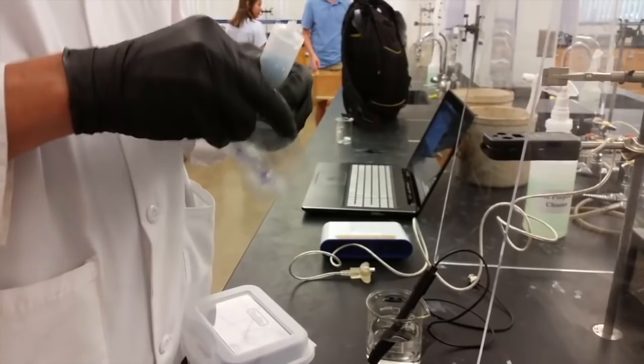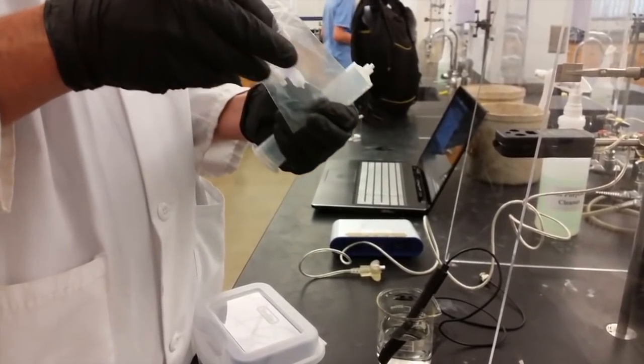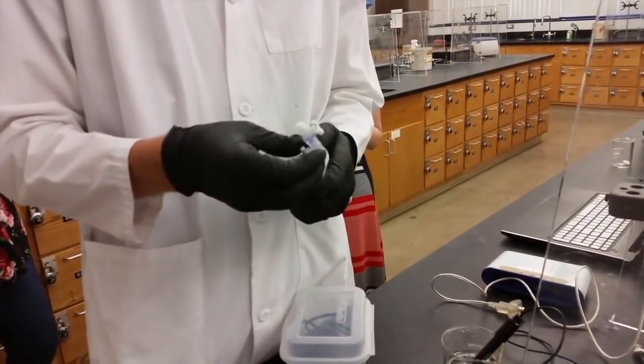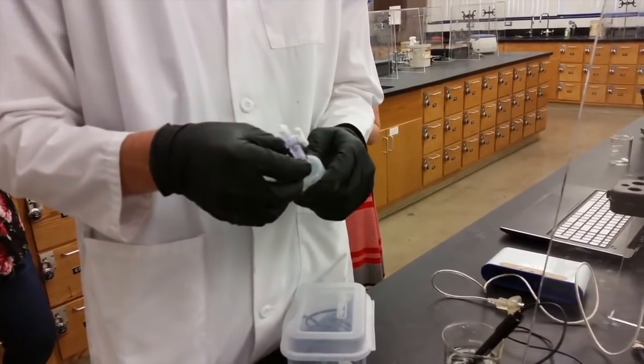The stop cocks are very delicate and break easily so make sure that you only tighten them until they are just barely finger tight. If you break the stop cocks unfortunately you'll have to pay to replace them.